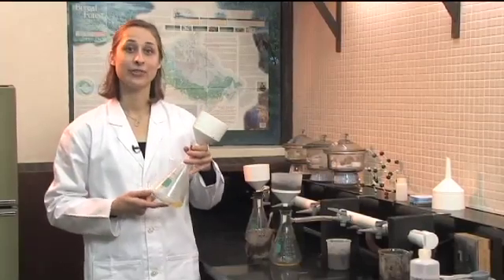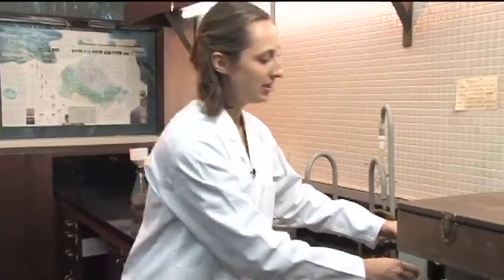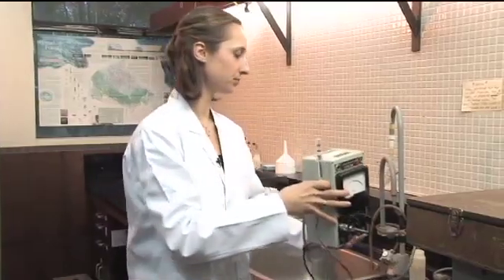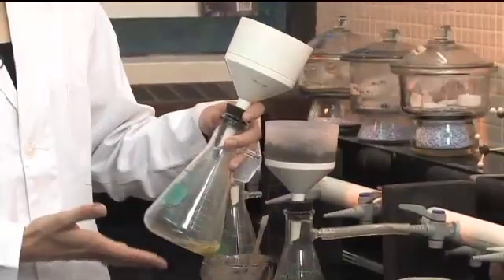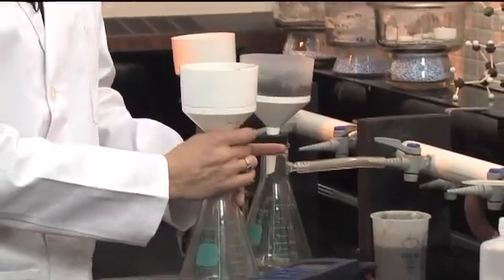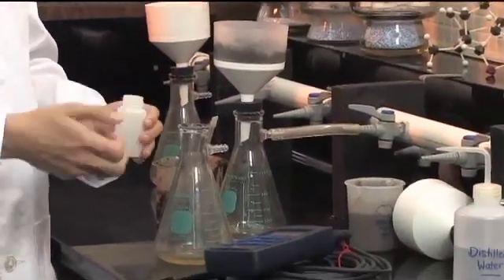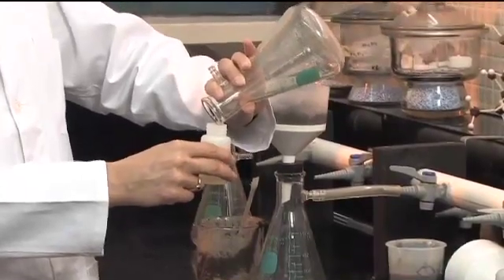Now we need to measure the electrical conductivity of the filtrate, so we need an EC meter. There are different sorts of meters. An example of a lab meter has a probe you stick into the sample. We also have a field-type meter that is newer and has a digital readout — that's the one I'm going to use today. We want to put the filtrate into a different container, so take off the funnel, grab a smaller container, and transfer the filtrate.